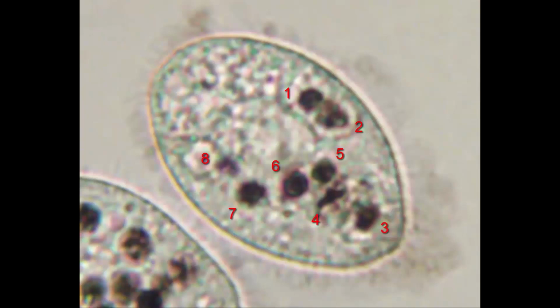Often there are some tricky calls to make. Zoomed in like this, it's easier to tell that this mass is 2 vacuoles right next to each other. This more faint spot is likely a vacuole out of focus, so we'll include that. I think this oddly shaped structure here is a vacuole in the process of forming, which I typically include in my counts. I don't count these tiny black dots that you often see at the wider end of the cell.